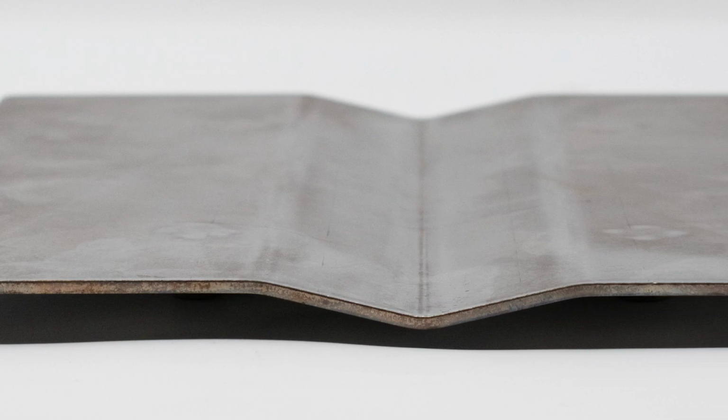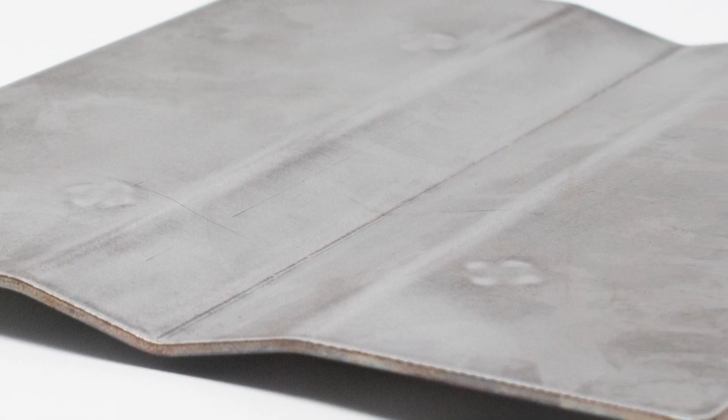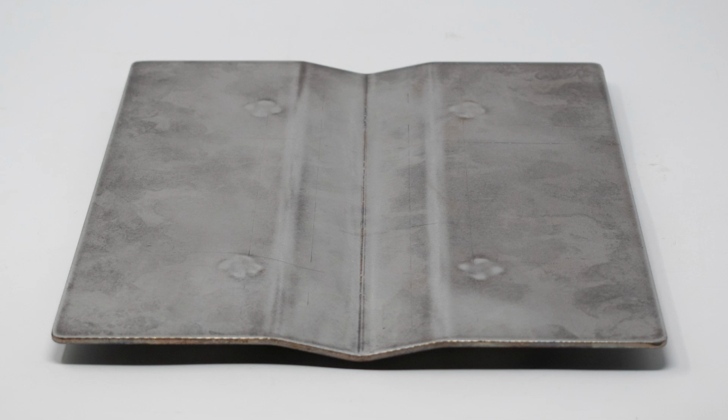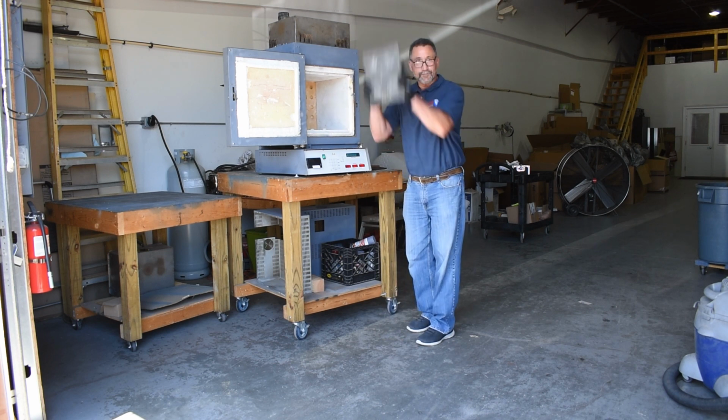We originally designed our hearth plate to replace the current ceramic plate. Our hearth plate stays in the ceramic tubes and doesn't warp so that your basket has a stable platform to sit on. So why did we break this hearth plate?